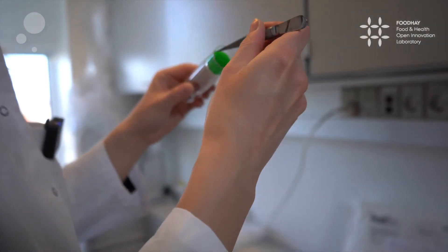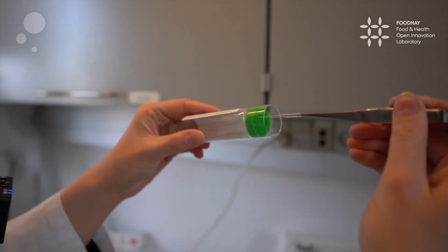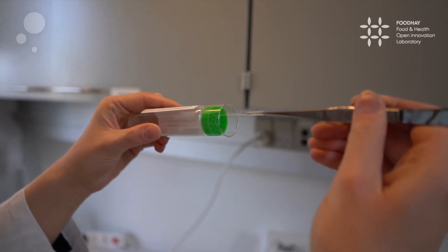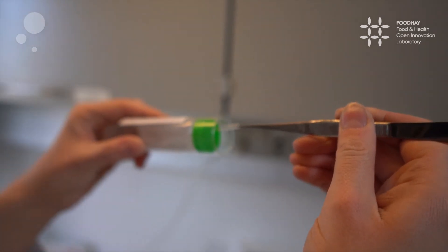In the case of liquid samples, we use these glass capillaries for loading. As you can see, these capillaries are very thin-walled glass. Up to 200 microliters of sample can be loaded in here, and after loading they are placed in the special sample holder that is then inserted in the sample stage before the beginning of the measurement.